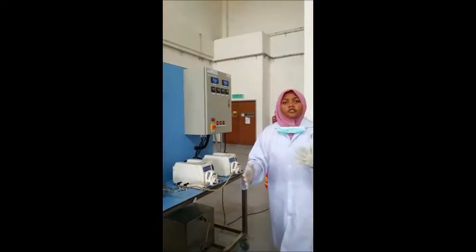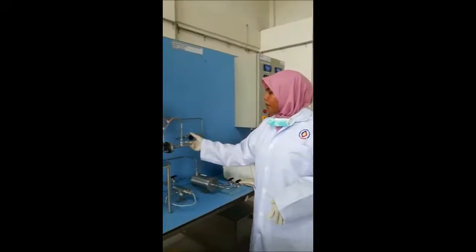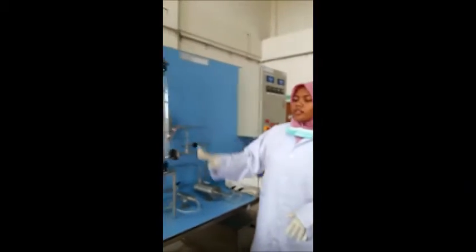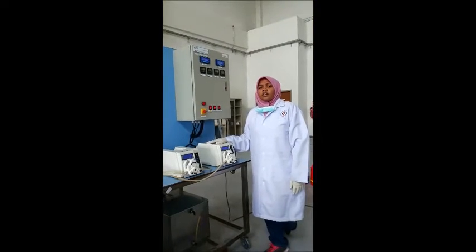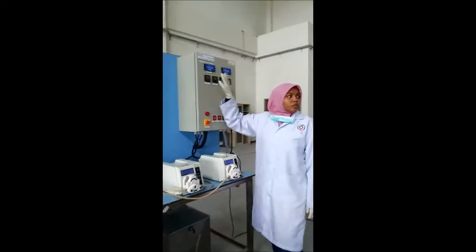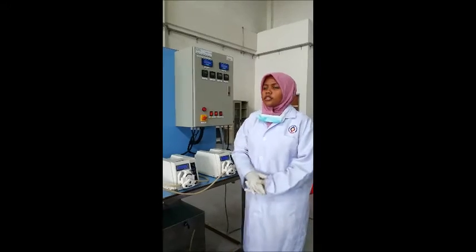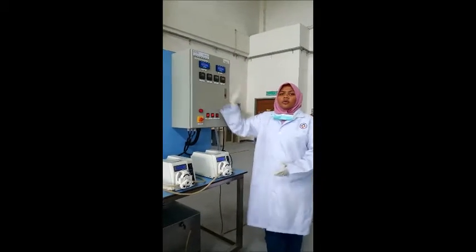In order to ensure that the water is circulating, all of the valves should be open so the water will only circulate in this unit. The water should be circulated until the reading of the conductivity is as low as possible. And according to the technician, the conductivity won't be zero, so we just wait.